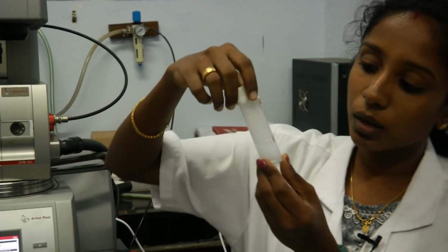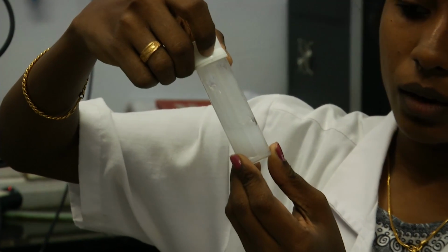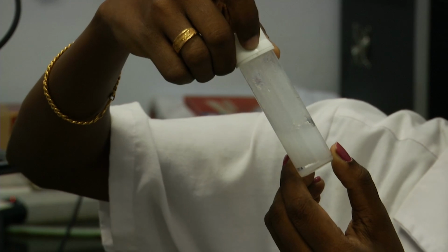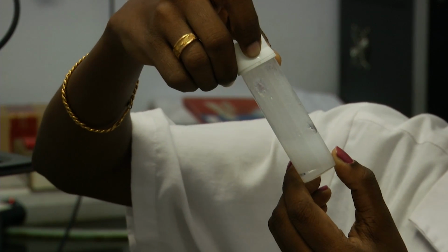This is the material that we are going to use today. This is silica stabilized decane in water emulsion. You can see the droplets on the walls of this vial. On the microscope we can see it more clearly. These are micron size droplets, around 50 to 100 microns in size.